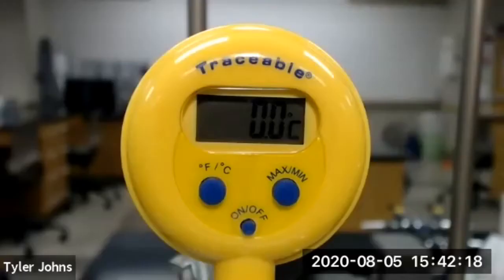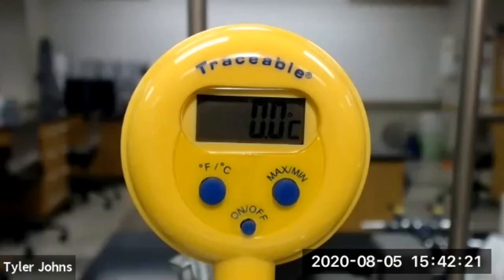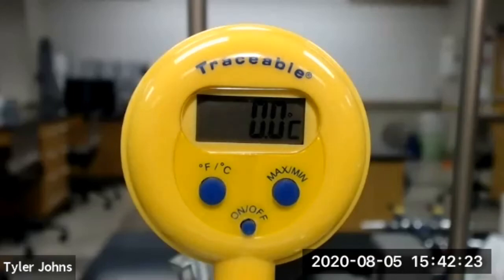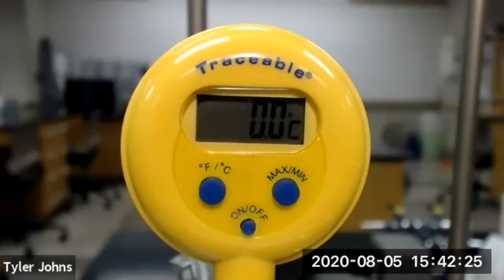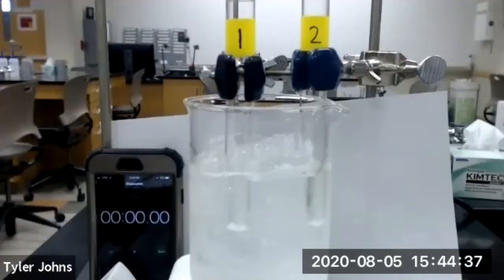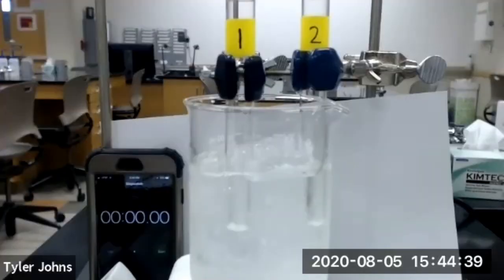The initial temperature of the reactants for trial four of part B is 0.0 degrees Celsius. We'll now start trial four of part B.